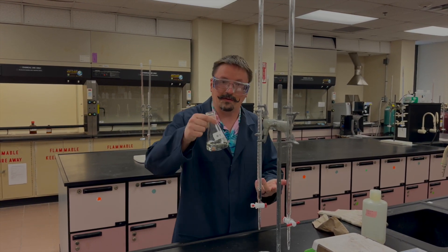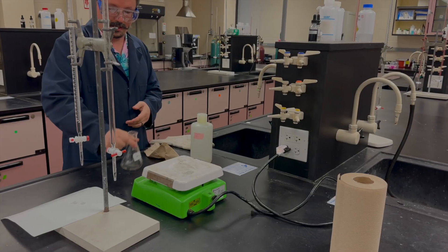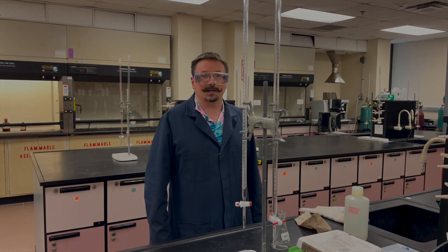This is safe to go down the sink. As soon as you're done with this, you can sink it, clean up all your glassware, and you're all done. That's it.